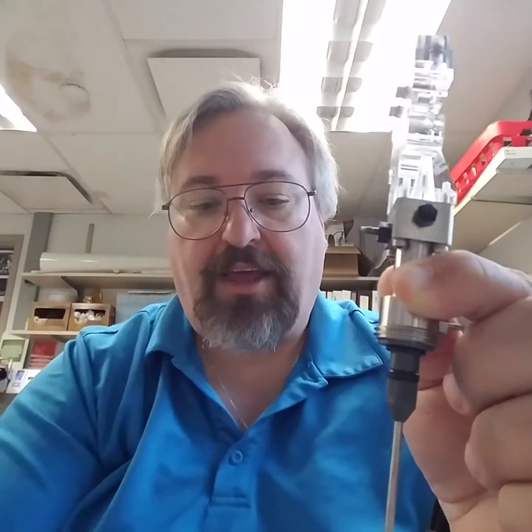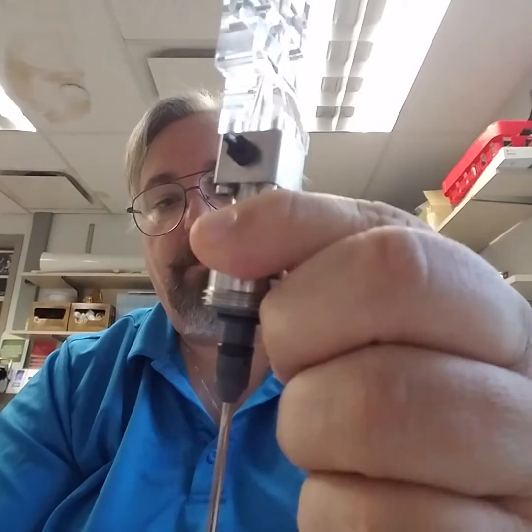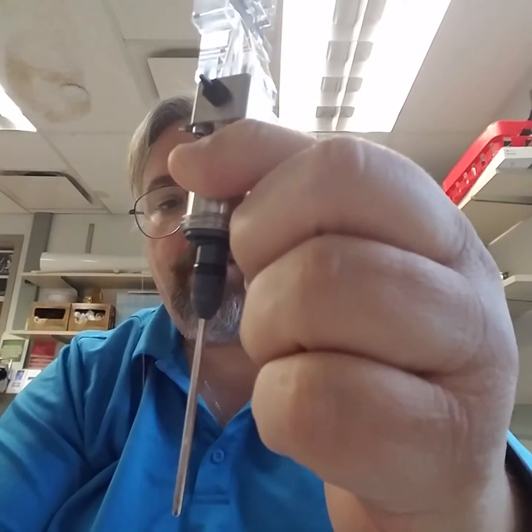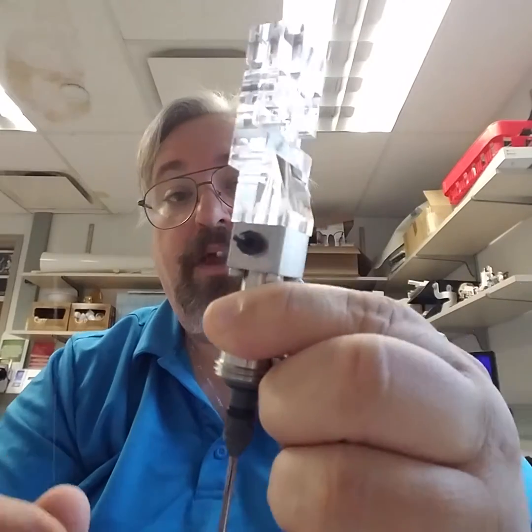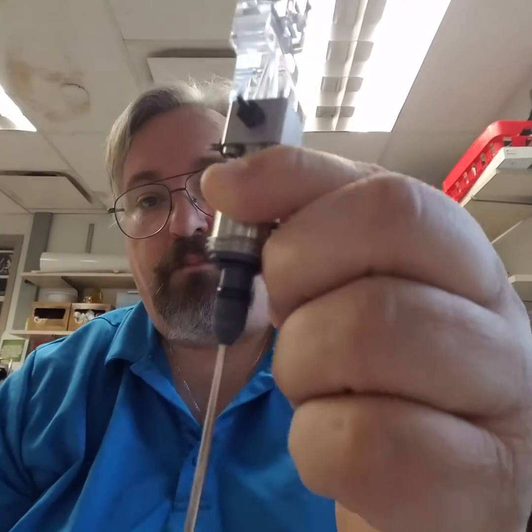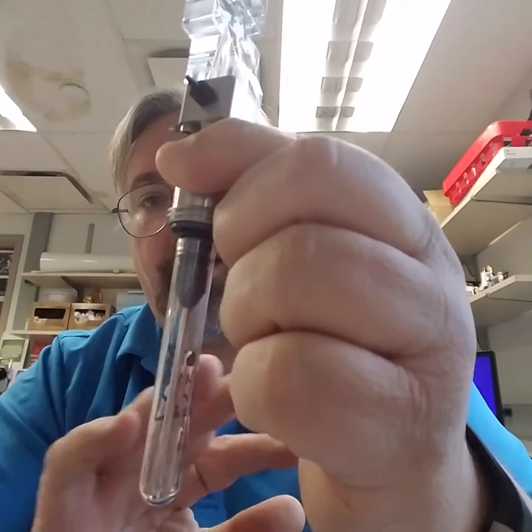Step two is to take something like this — a stylus — and insert it into this sip here, and clean it up by moving it up and down and pulling it out. Be careful to hold on to it so we don't lose it in the flow cell. Again, beads go back on. If still no beads, we're starting to get to a serious clog.